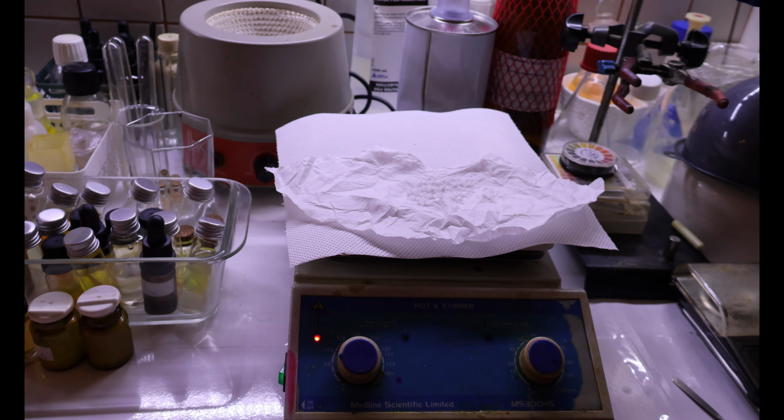So, all I do have is a ferric chloride test and just the crystal morphology to go about. So judging by that, I can only suggest that this is acetylsalicylic acid. Other than that, I have no other proof to show to you guys and girls and whatever else that this is acetylsalicylic acid. It most likely is.